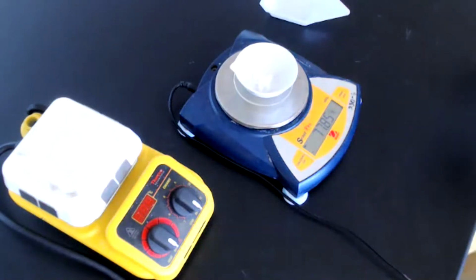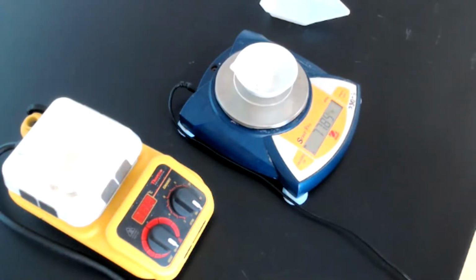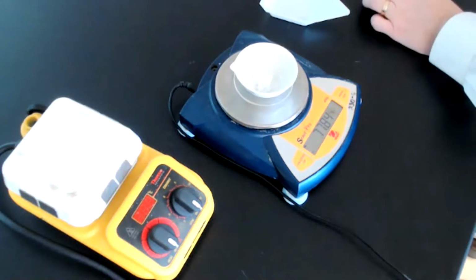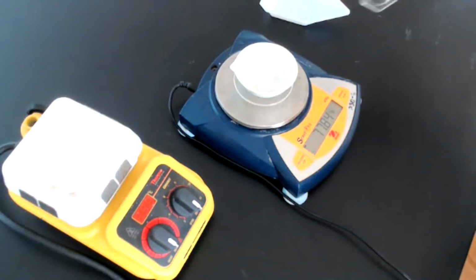Now, if we go back and look at our procedure here, it says slowly add 20 milliliters of acetic acid to the sodium hydrogen carbonate in the evaporating dish. Then carefully add additional acetic acid from the dropper until the bubbling stops. So we're going to begin by adding some acetic acid. Basically, we want to make sure that we add enough so that all of our sodium bicarbonate has reacted, but not so much extra that it's going to take us longer to evaporate off our solution. So we're going to start by adding 10 milliliters at a time. So this is our first 10 milliliters.